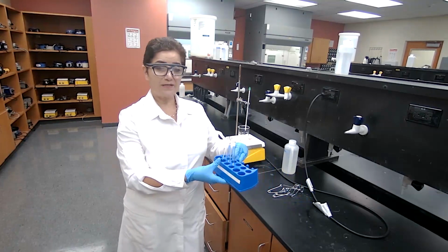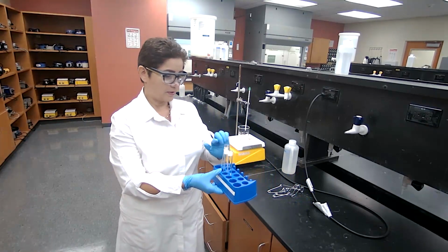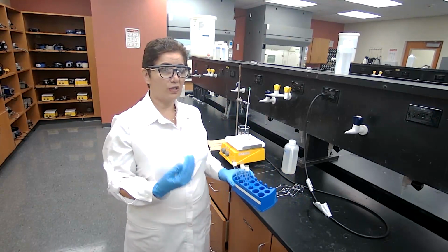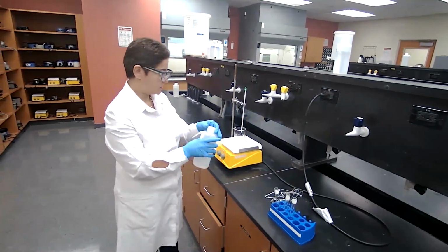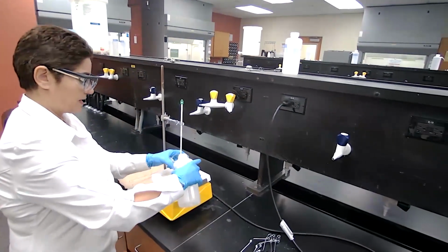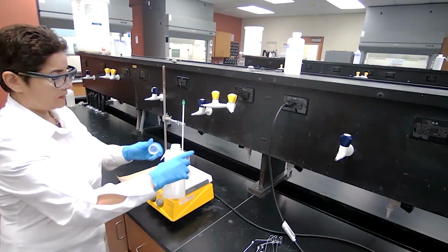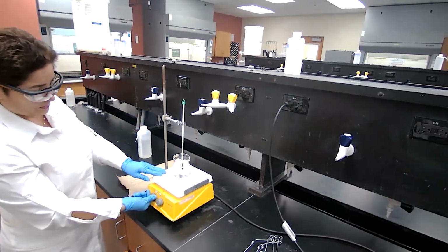I use the test tube rack, and I label my test tubes A, B, and C. We are going to measure the solid compound and the liquid and the catalyst. Besides the catalyst, this reaction also requires heat. A temperature around 80 degrees is good enough. So I'm going to start by preparing a warm water bath to make sure that it reaches 80 degrees. While I'm measuring the mass and the volume of my reactants, I'm going to turn on the hot plate.